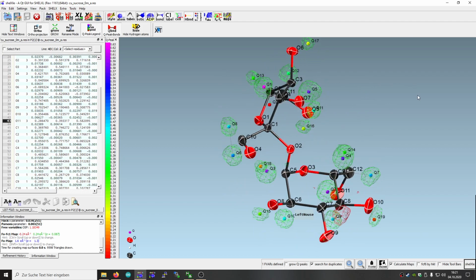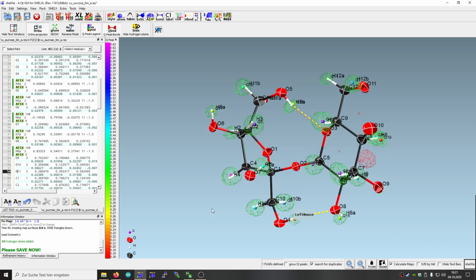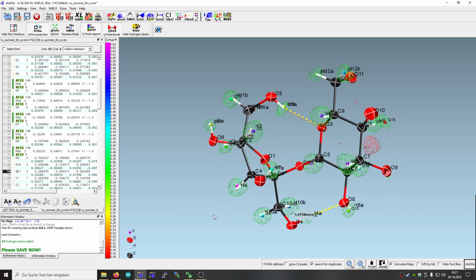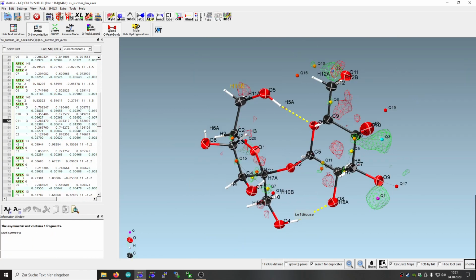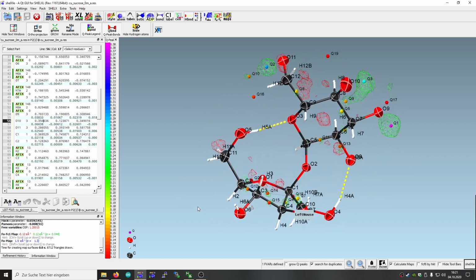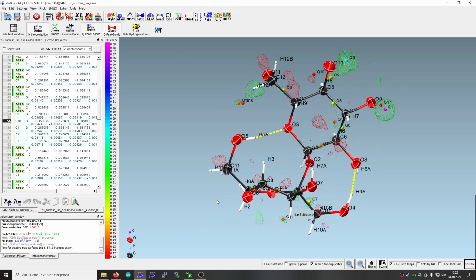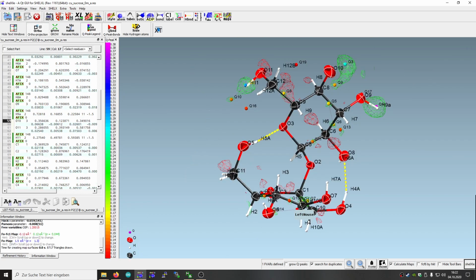See, we have some hydrogen atoms, and let's try if we can auto HFIX some of them. Yes, seems to be the case that we got some of them. So let's see. After refinement, we have some missing hydrogen atoms. And this means we can try again. Sometimes it finds some. Yeah, it found two of them, as you can see here. But we are missing three of them.